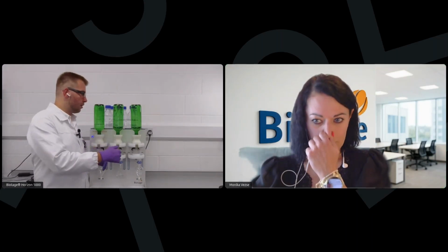When you talked about filters, if the system clogged, would it guide you on what to do so you don't lose your samples? Currently, if we have a sample that is dirty, we get a slow load and the system will stop, but not give any way to solve the situation. So the answer to this is very simple, really.